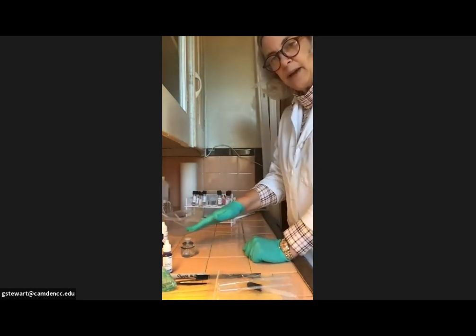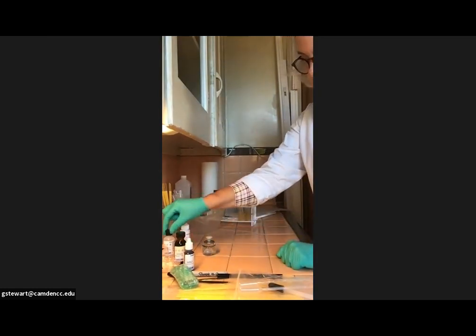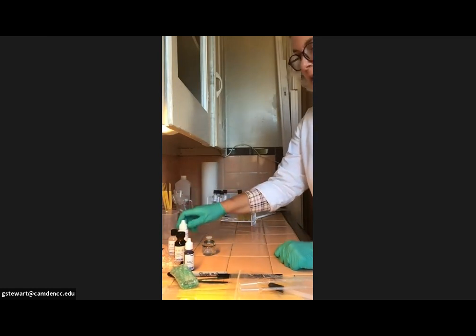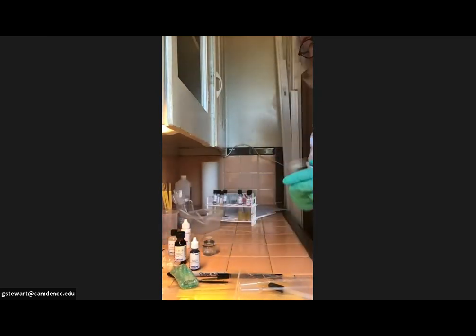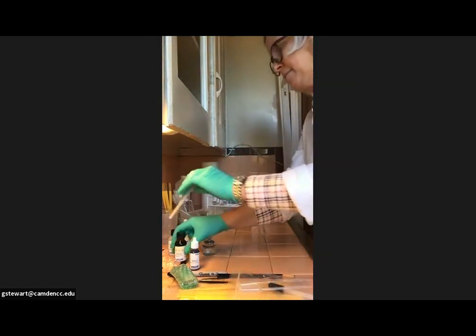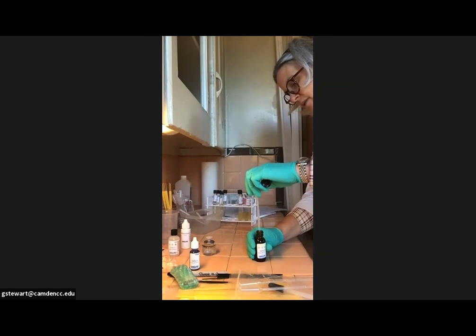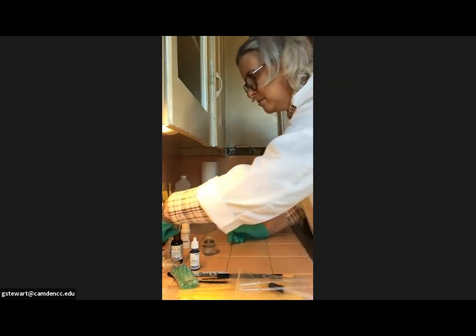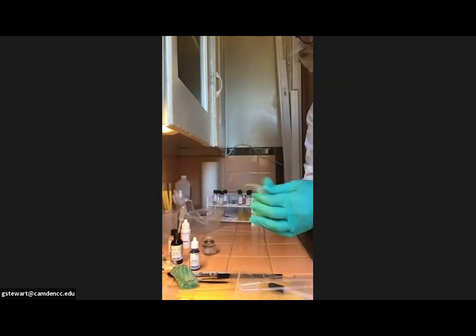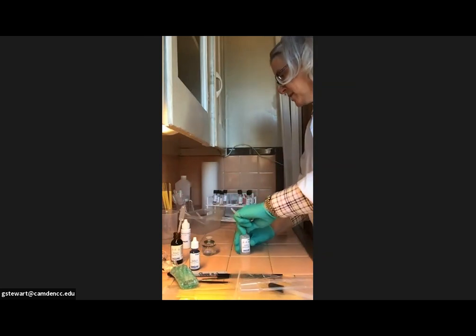And you might notice that I've arranged my reagents here in the order that I'm going to use them: crystal violet, the Gram's iodine, the denatured alcohol, and then the safranin. Both the crystal violet and the safranin came in dropper bottles. The other 2 did not. So I'm going to insert a sterile pipette from my sterile pipette collection that came in my box. And I would give these a little shake before you put the pipettes in them. My Gram's iodine leaked too. When I pulled it out of the box, I noticed that it had leaked all over the place. So I'm just going to set that aside and put the dropper bottles and eyedroppers in there so that when I go to reach for them, I am all set and ready to go.